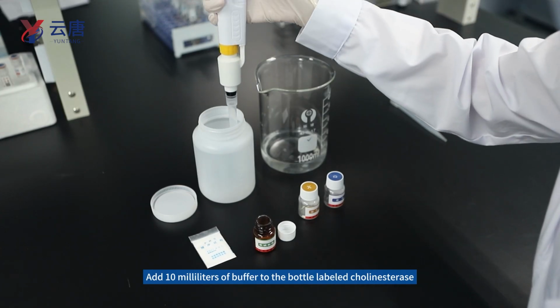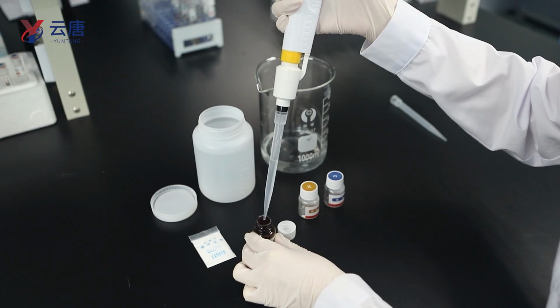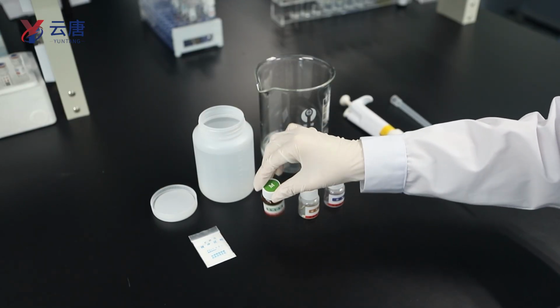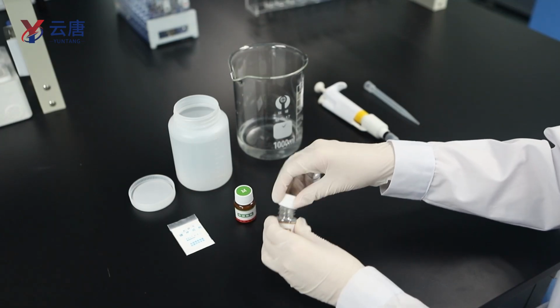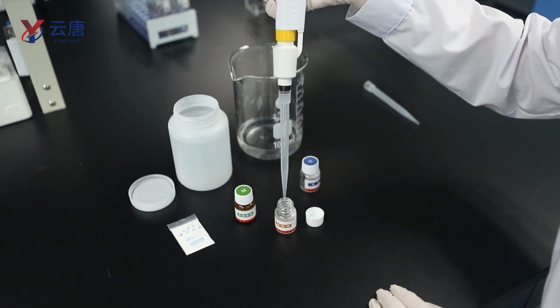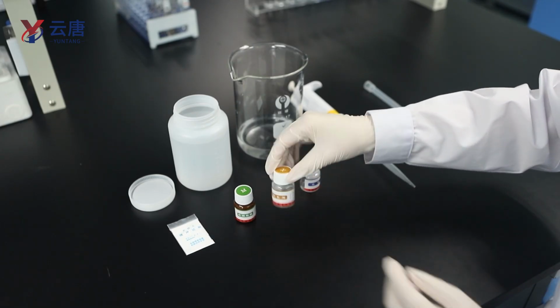Add 10 milliliters of buffer to the bottle labeled cholinesterase. Add 10 milliliters of buffer to the bottle labeled as color developer. Shake mix.